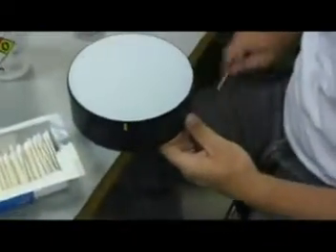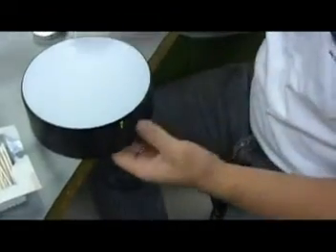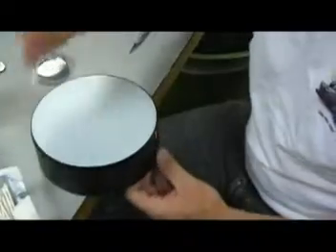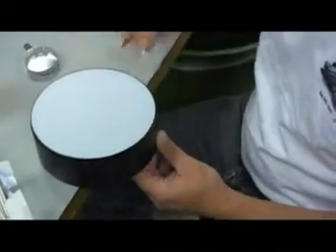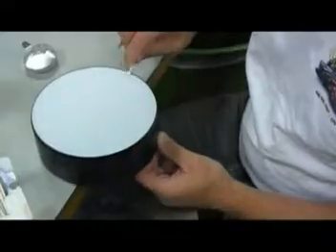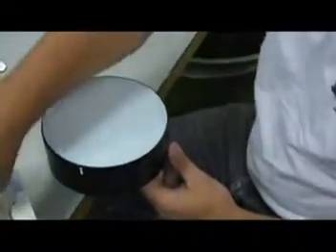Now we're going to take some isopropyl alcohol. When we press that cover into the holder, there will be some RTV that's squeezed out. We'll use our Q-tip now, with a little isopropyl alcohol, and we'll clean off that excess. Nice and slow, take your time, and we'll have a cover that is as good as new.